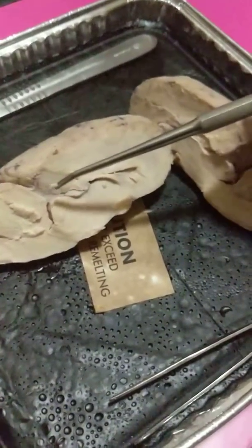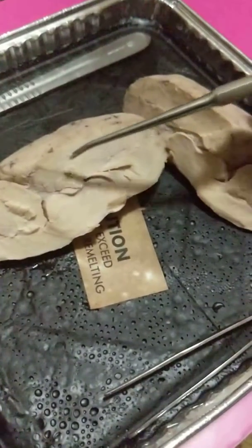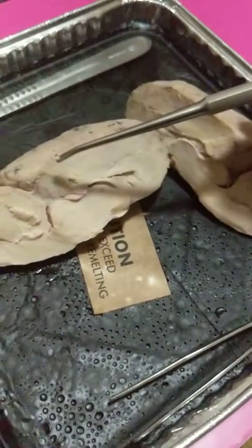And that will conclude my dissection of the brain.